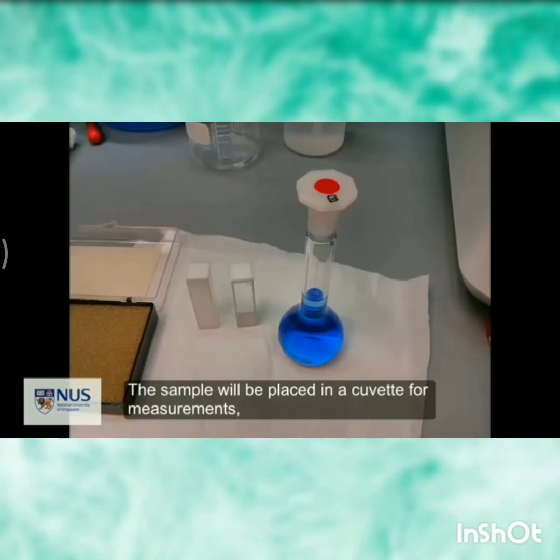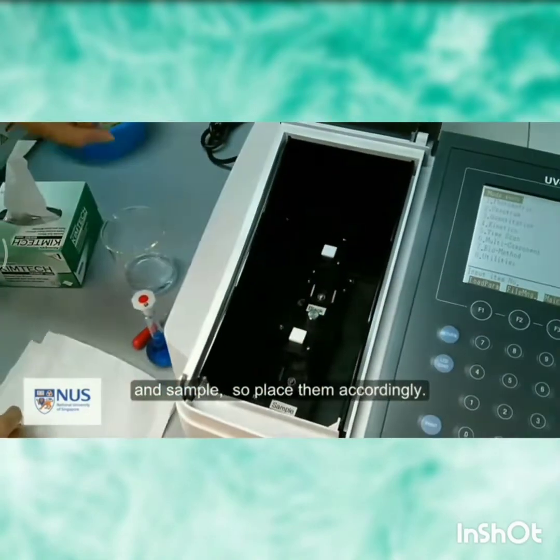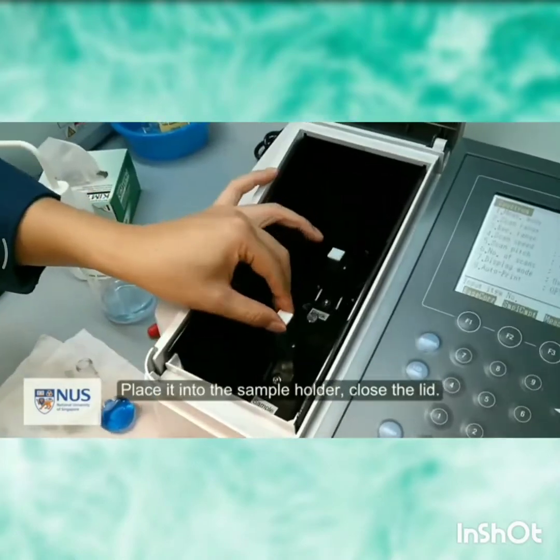Then, start the experiment by using a blank solution to calibrate the instrument and analyze the sample by using the spectroscopy instrument.